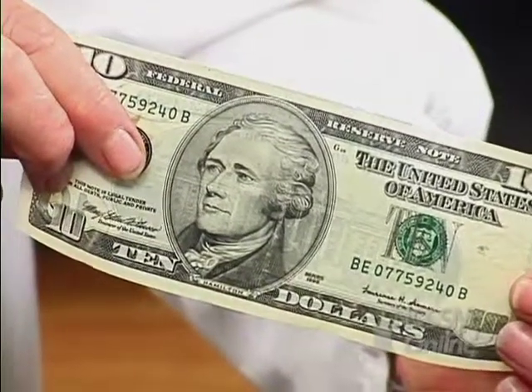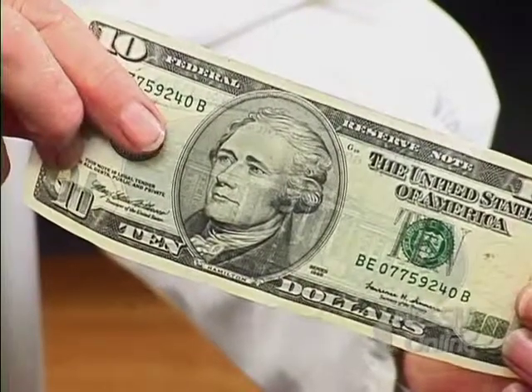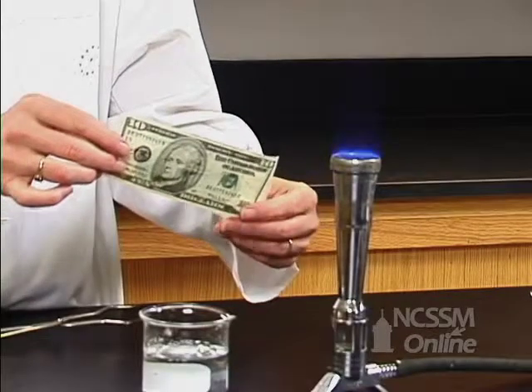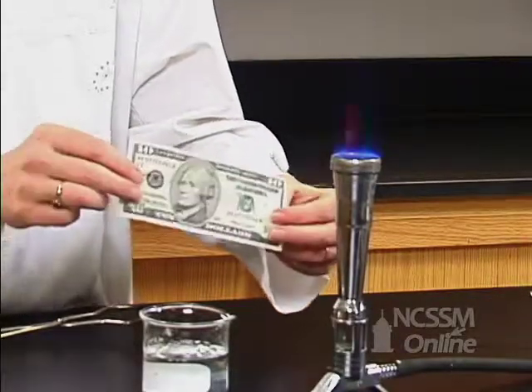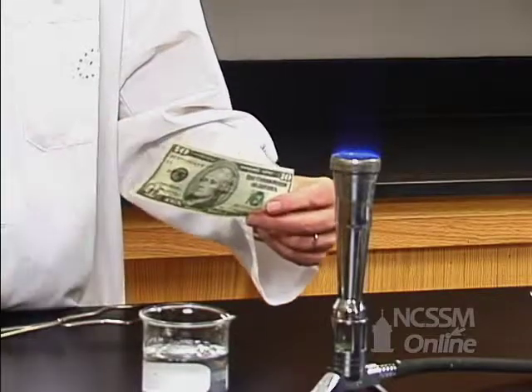Here we have a $10 bill, and what we're going to do is dip it into our fuel and burn it, and then see if we can figure out the energy involved in this reaction.